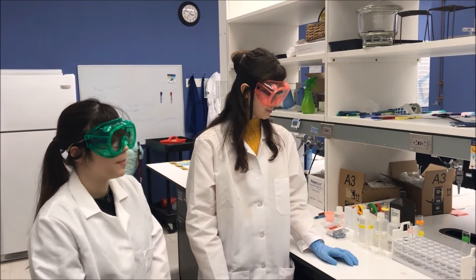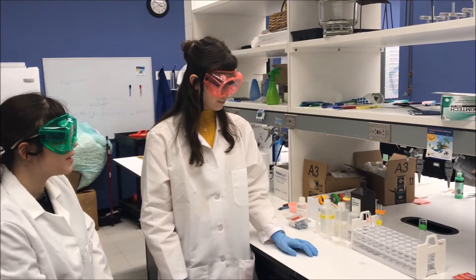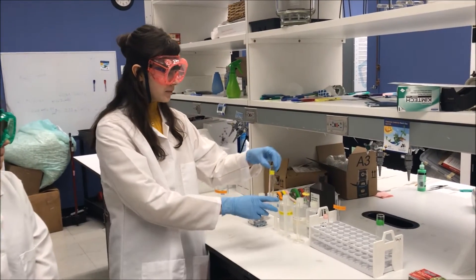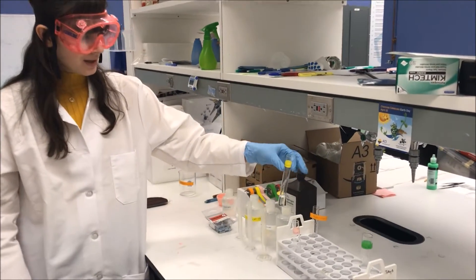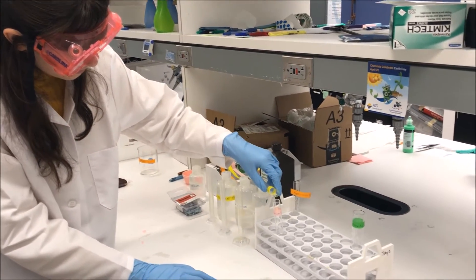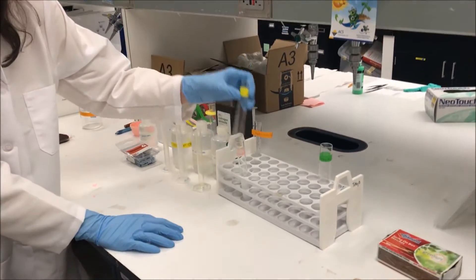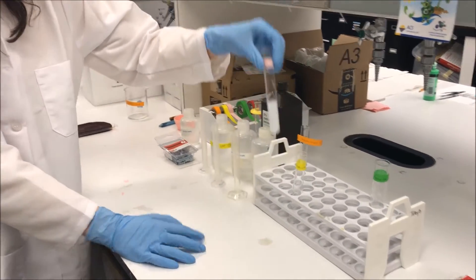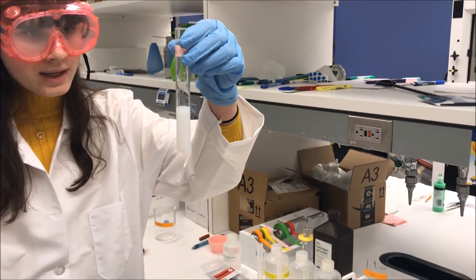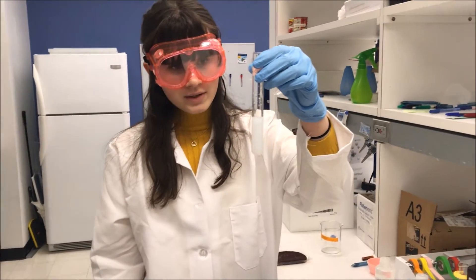Now we will be doing reaction type B and we have selected to do procedure two. We have pre-measured five milliliters of calcium chloride and sodium carbonate. Now we will put the two solutions together into one test tube. We can see the formation of a precipitate, which would be calcium carbonate — the scientific term for chalk. This is an example of double displacement.